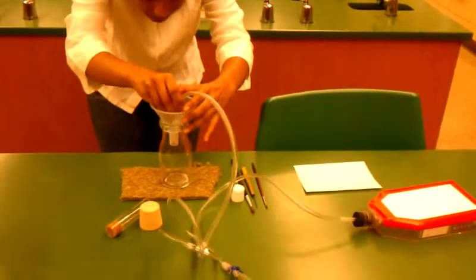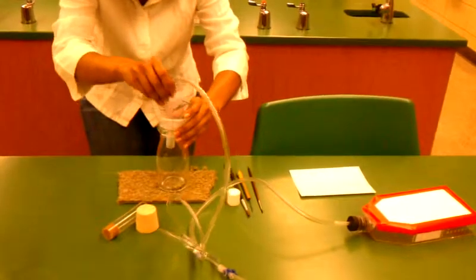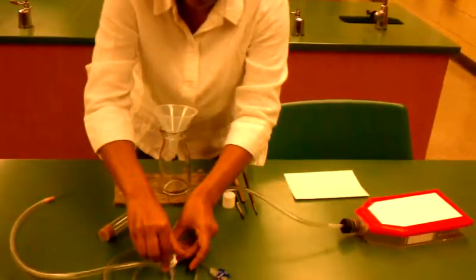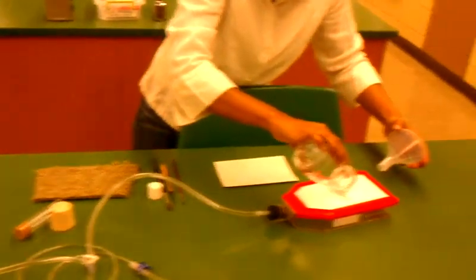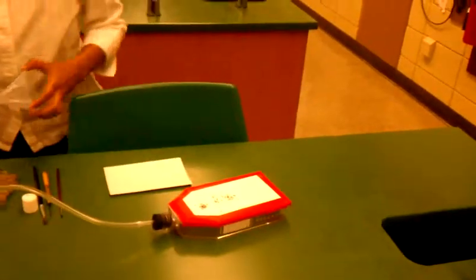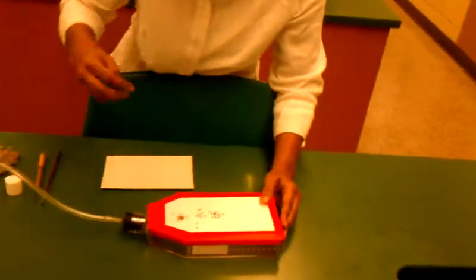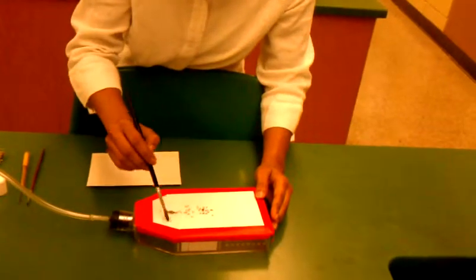Once the flies have been knocked out, switch the position of the valve so that the CO2 is now coming through the tray. Shake the flies on the tray and that should be all you need. Just straighten them out so you can look at them under the microscope.